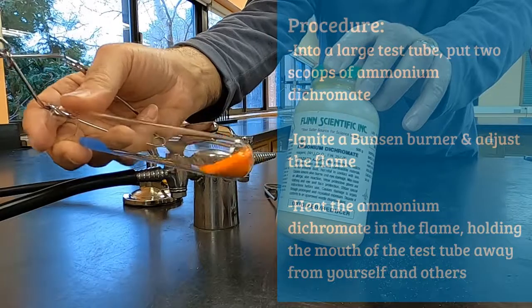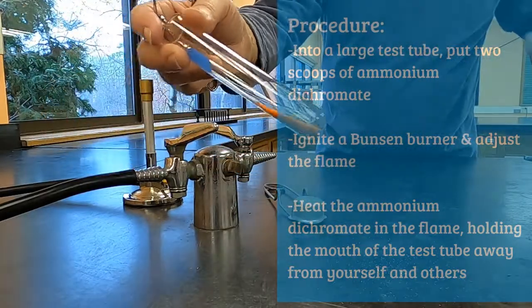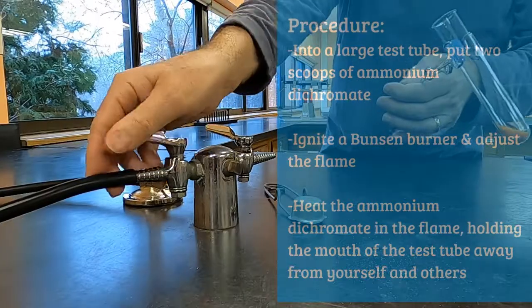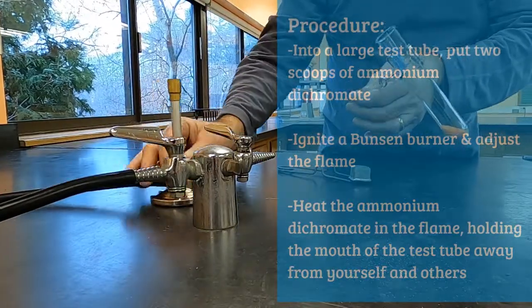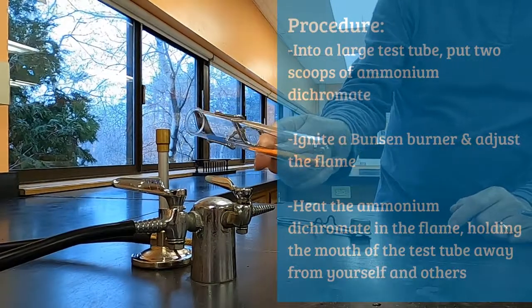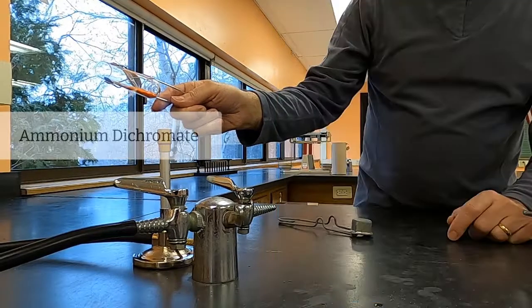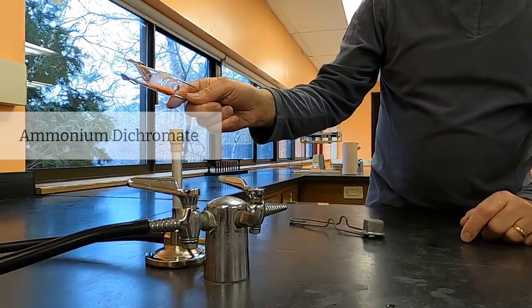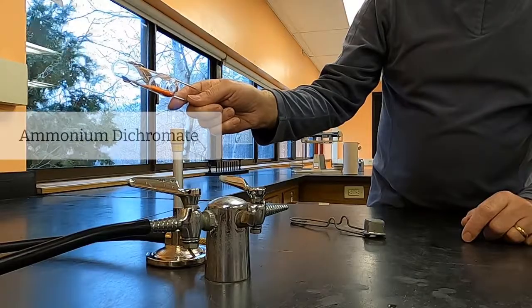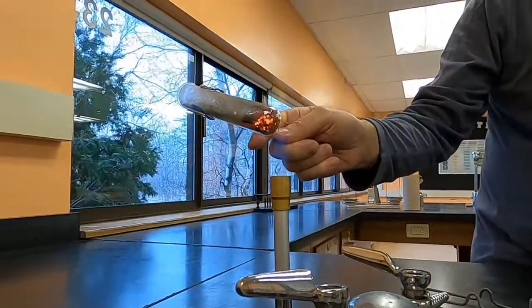Next, you're going to make a big old mess by putting some ammonium dichromate into a heat source. What it does is it turns the ammonium dichromate into chromium 3 oxide, which is a green powder, turns it into nitrogen gas and water vapor, which push the green powder out of the test tube. It's important to try to spread it out as much as possible and to keep your test tube tilted. That way you can heat it completely.